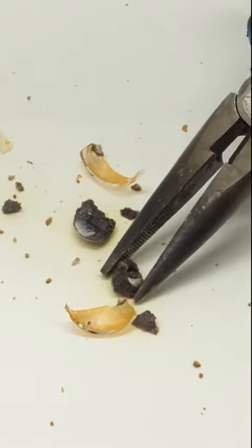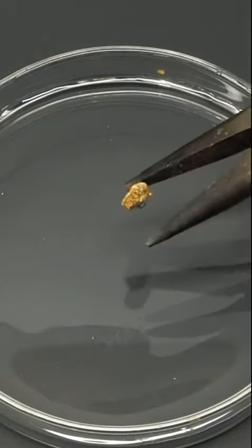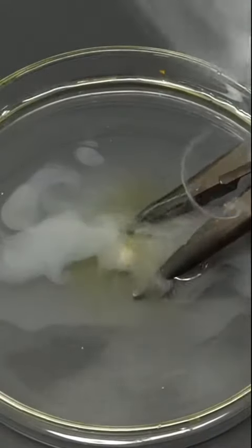To clean it up, I just have to drop it into water and all of the aluminum bromide almost instantly reacts.